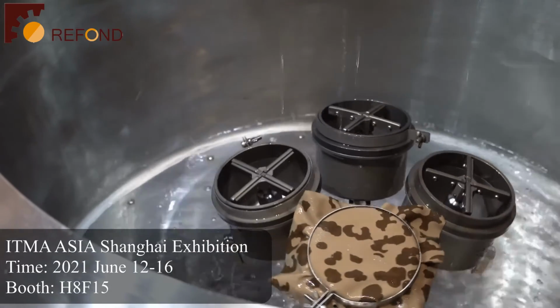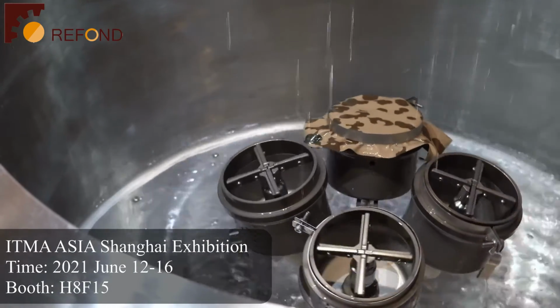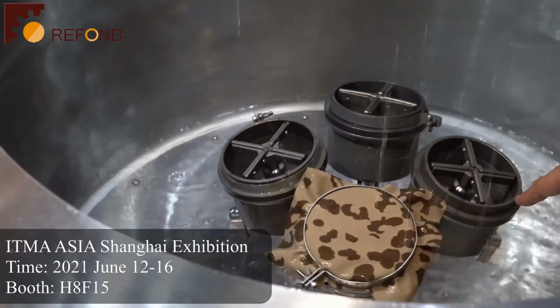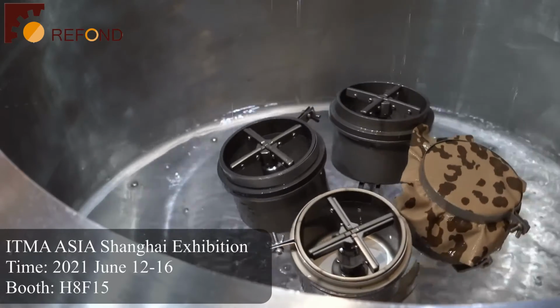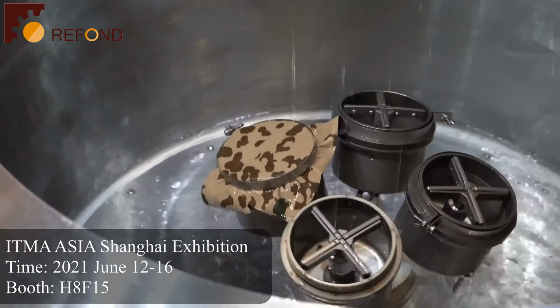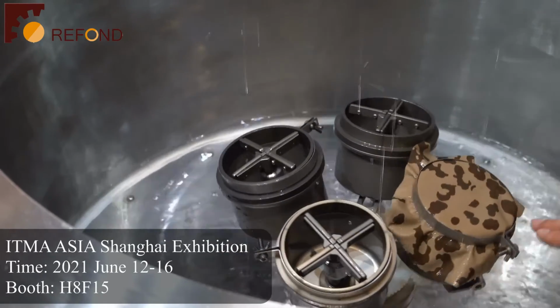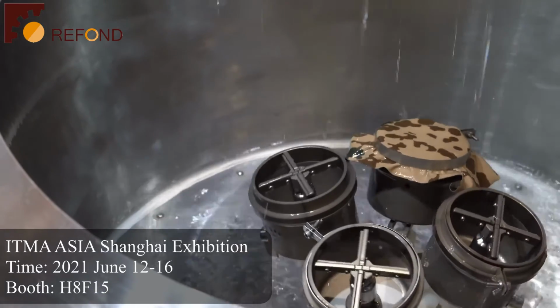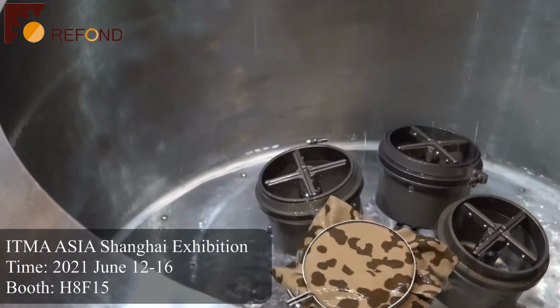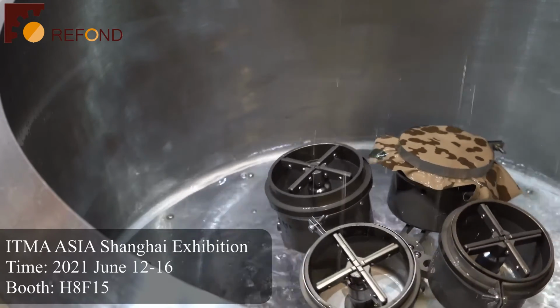After the test, the specimen will be removed for the assessment of the water repellency. And the water penetrated inside the cup, the water amount will be weighed after testing. So two different kinds of tests actually. One is for the assessment of the water repellency on the fabric itself. Another factor is how much water penetrated from the fabric into the cup.